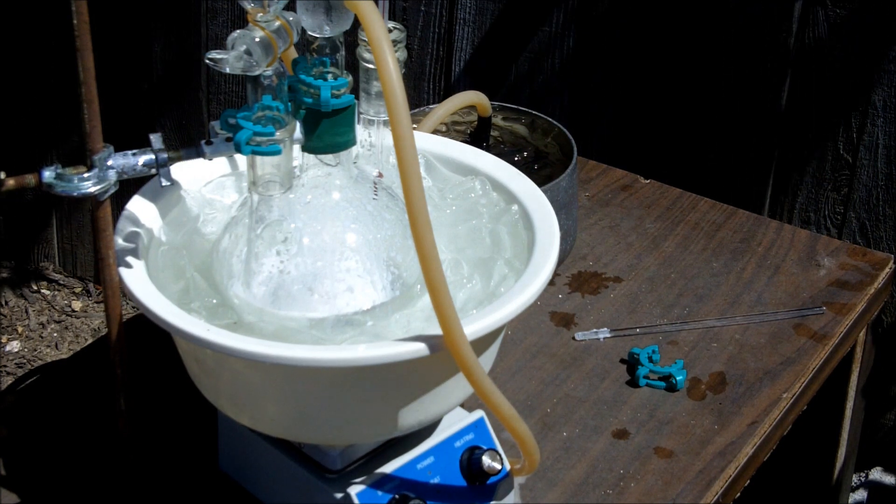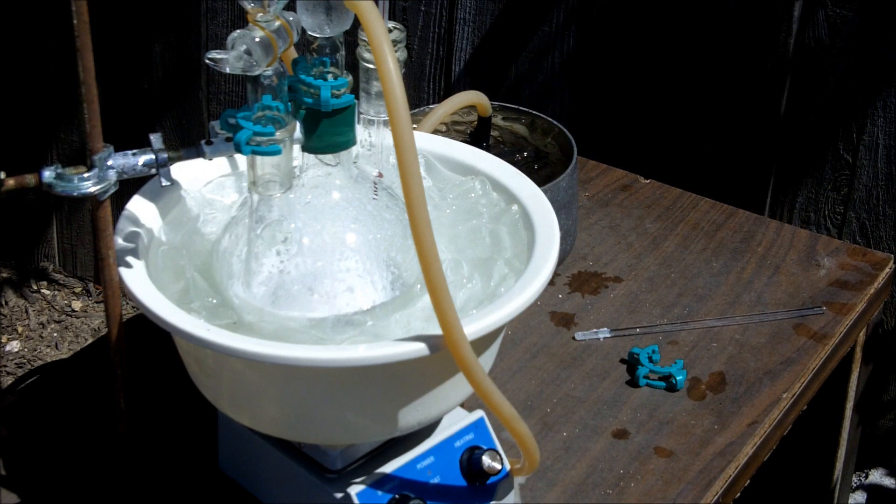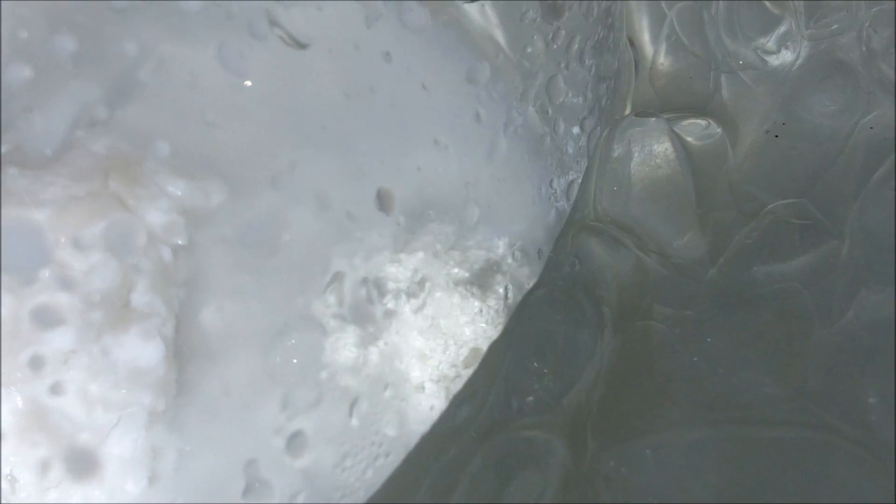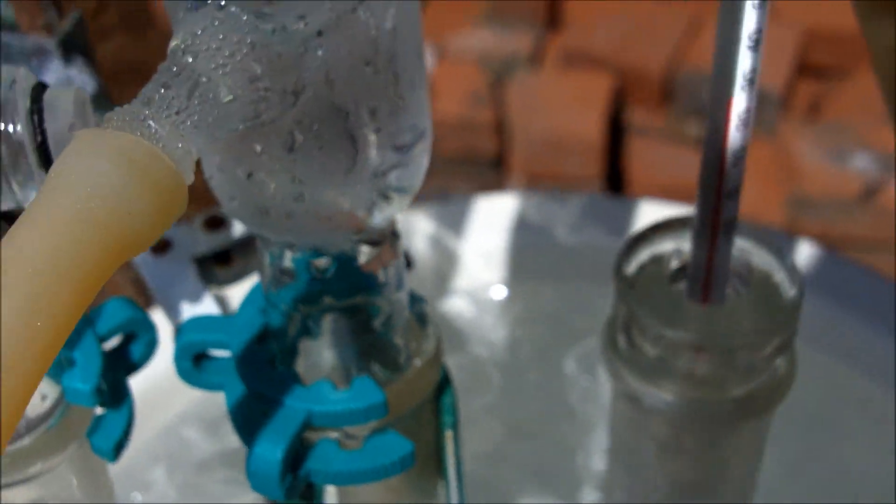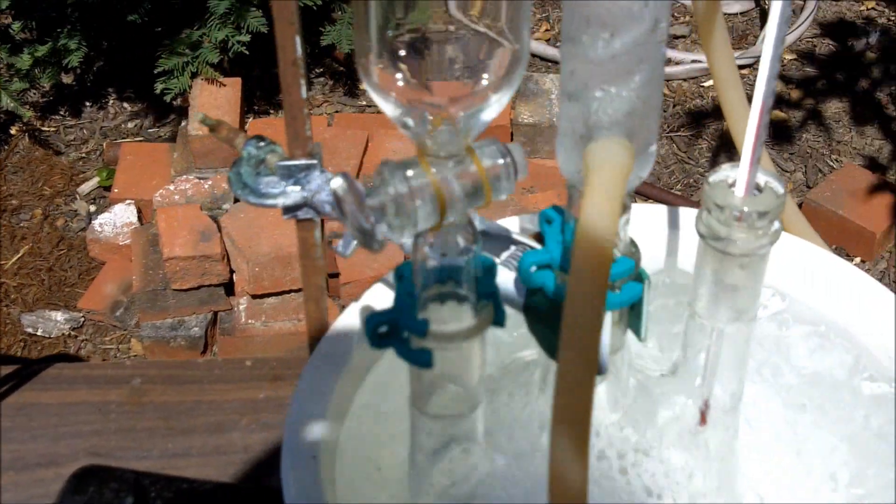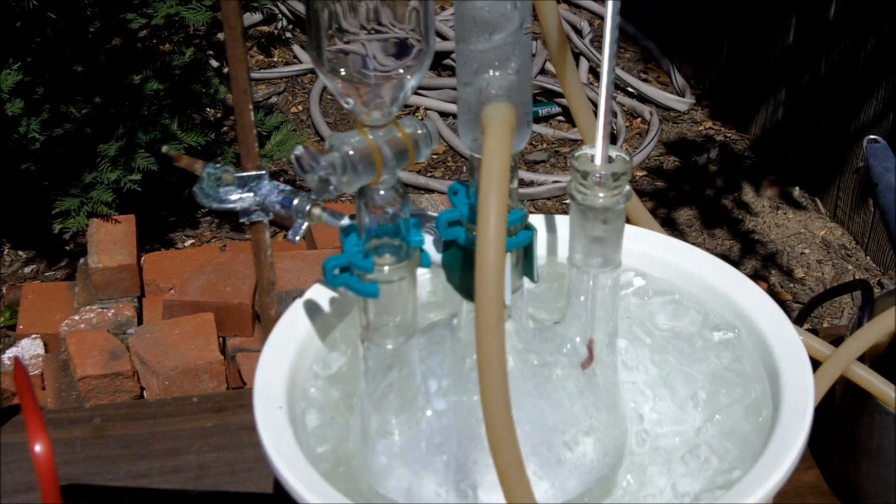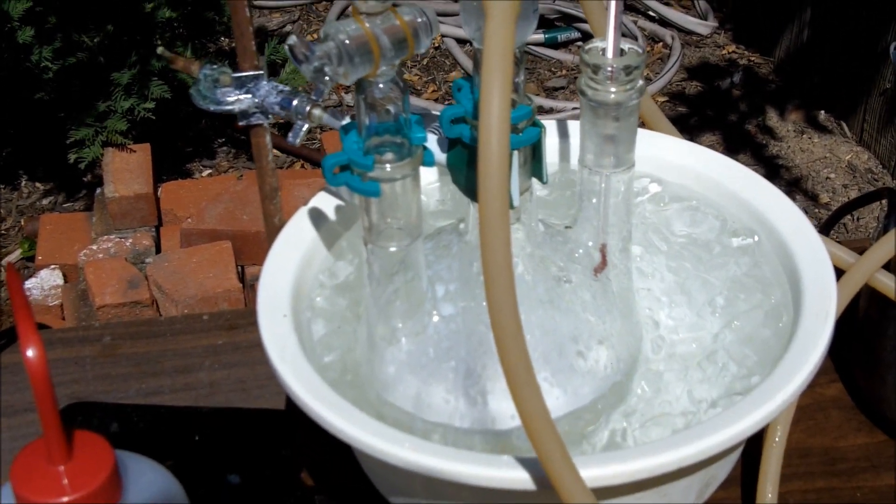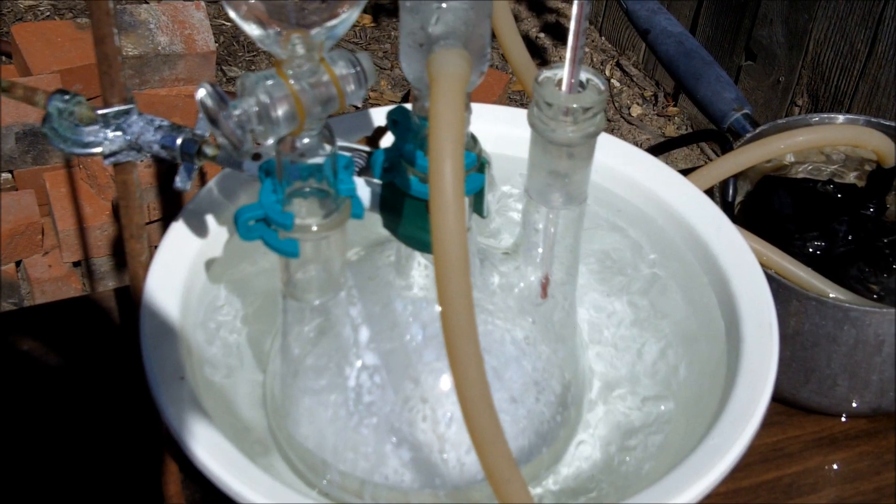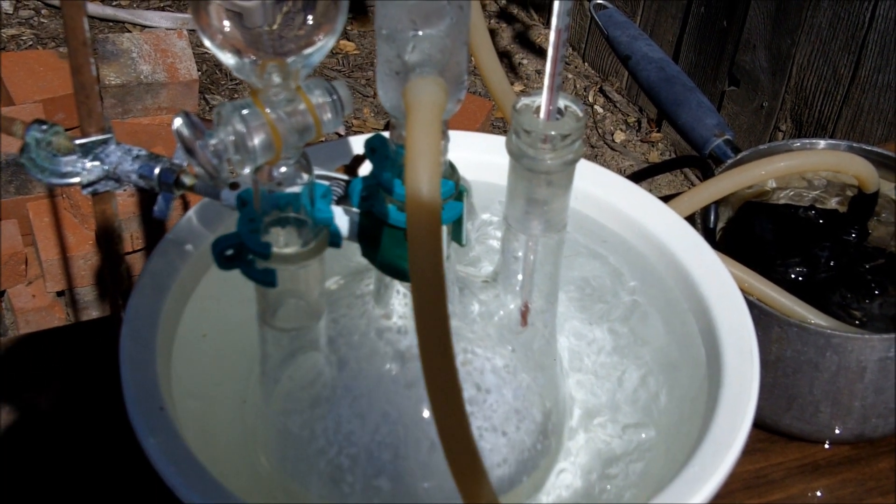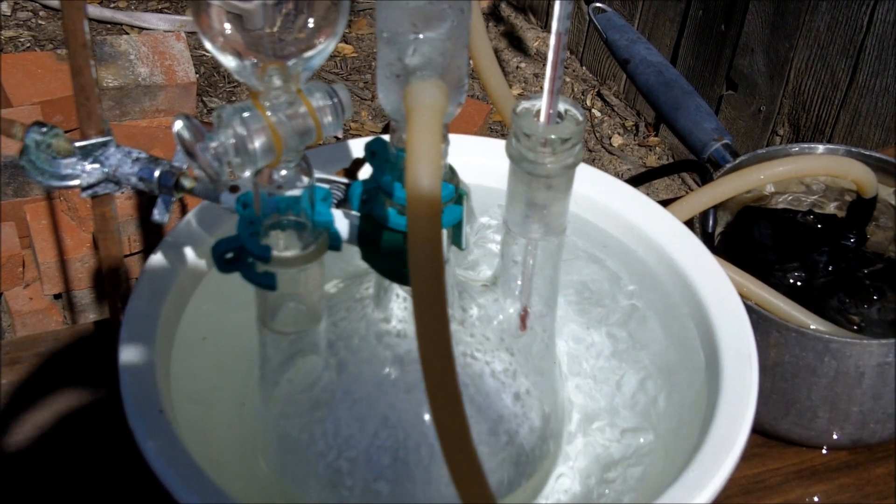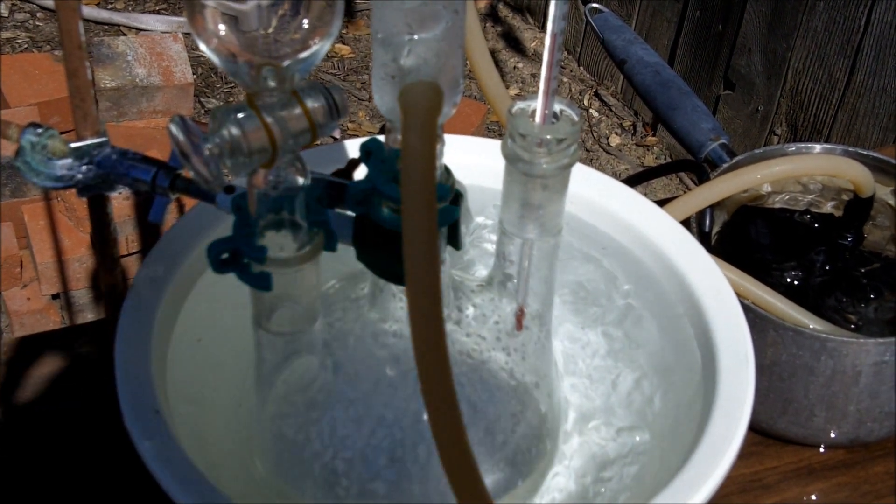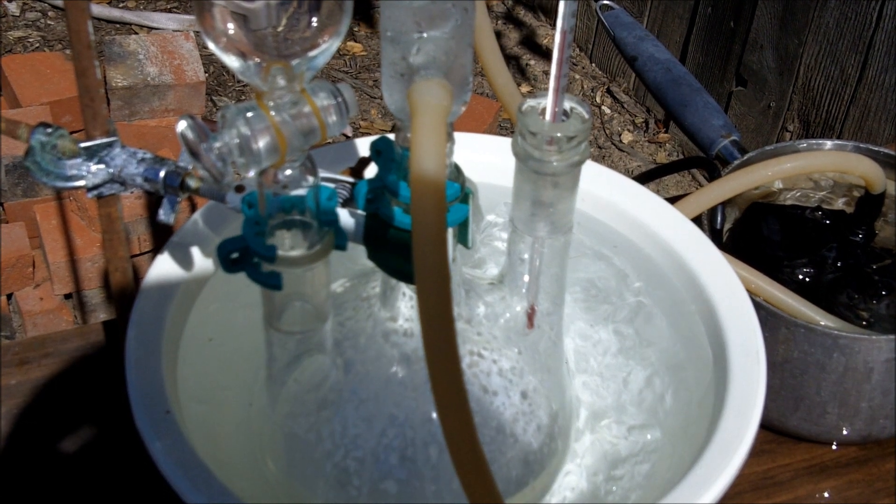Okay, I found out you need to add more calcium hypochlorite than I originally expected, so I had to add a couple hundred more grams carefully to the flask and the reaction resumed. I was running low on acetone so I didn't get to run this reaction as long as I wanted, but anyway, as soon as you know that the reaction is done, then set up for simple distillation.